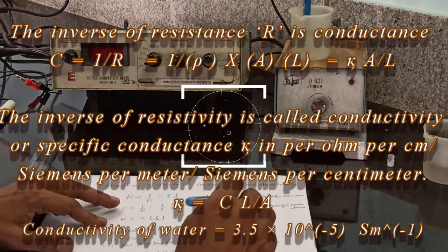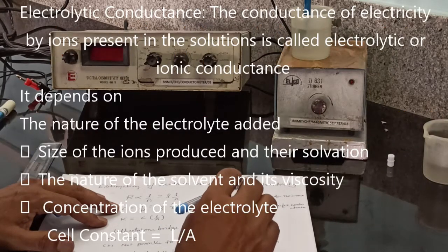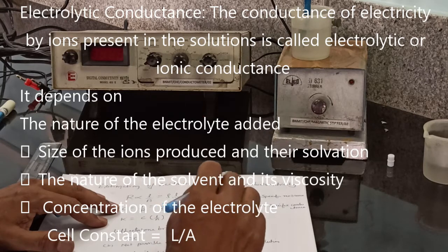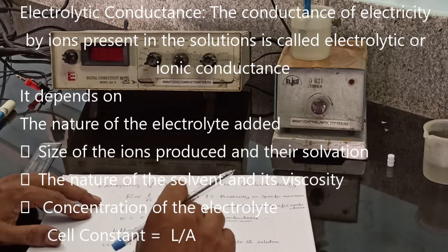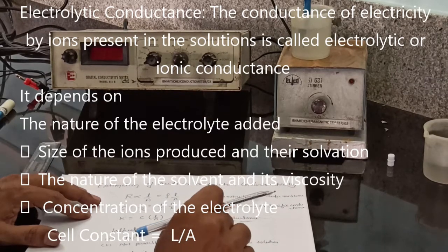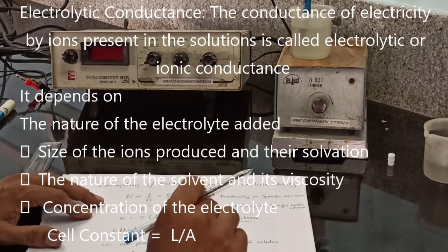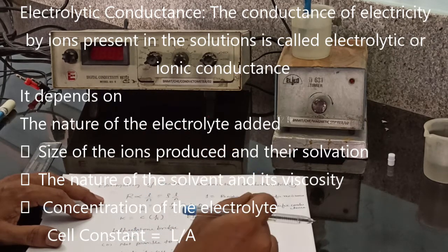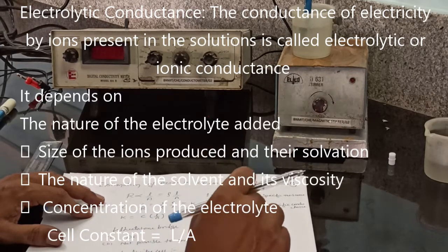Let us take an example of water. The conductivity of water is very low since it contains very few H plus and OH minus ions. If electrolytes are dissolved in water, the conductivity increases because the electrolyte furnishes its ions. The conductance of electricity by ions present in solutions is known as electrolytic conductance or ionic conductance. It depends on the nature of the electrolyte added, the size of the ions produced and their solvation, the nature of the solvent and its viscosity, and the concentration of the electrolyte.